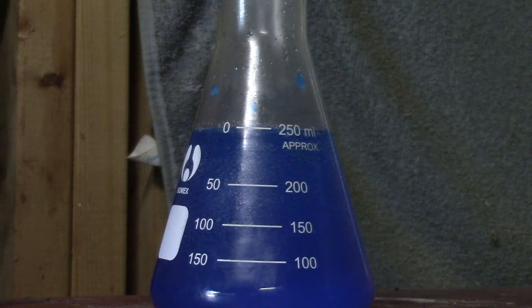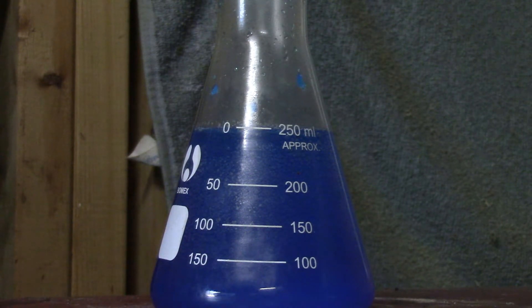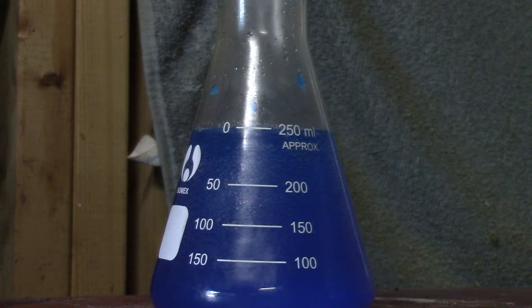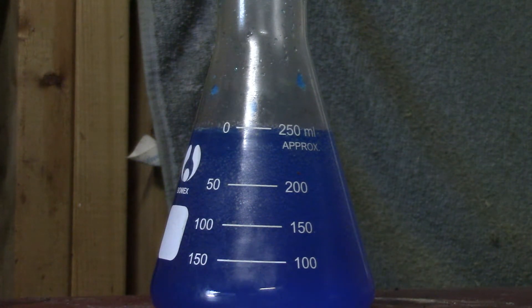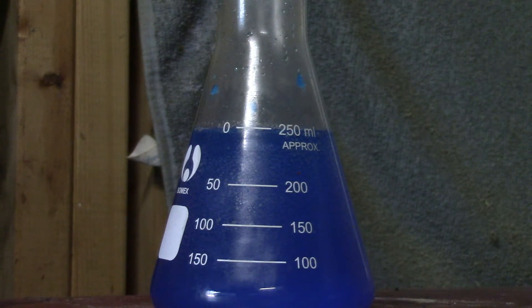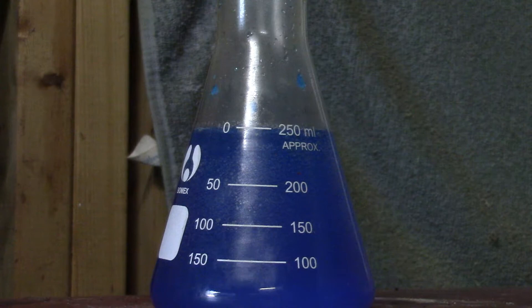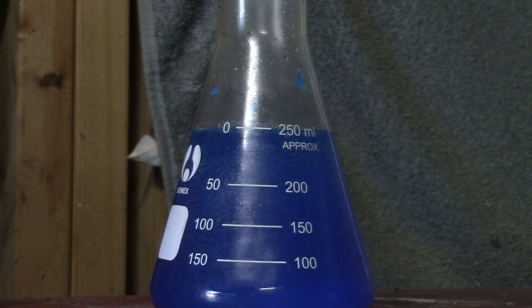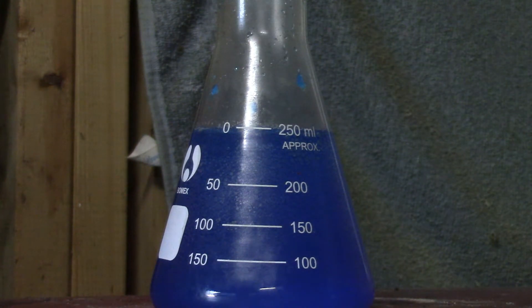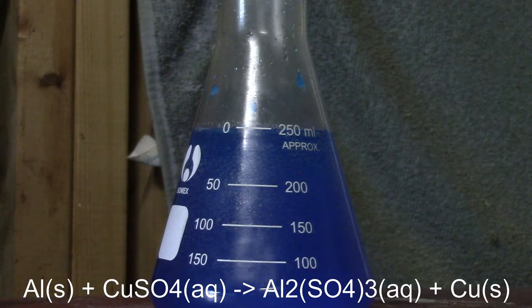The copper sulfate solution has the characteristic blue color. Off to the side I've got an empty Coke can that I'm cutting up into pieces because I want to use the aluminum in a single displacement reaction to get the copper out of the copper sulfate, thereby producing aluminum sulfate and copper metal.